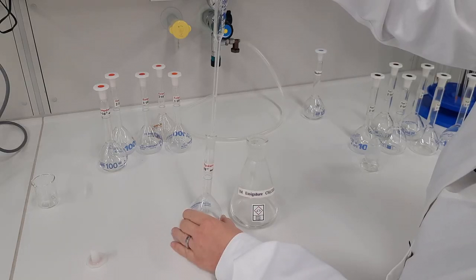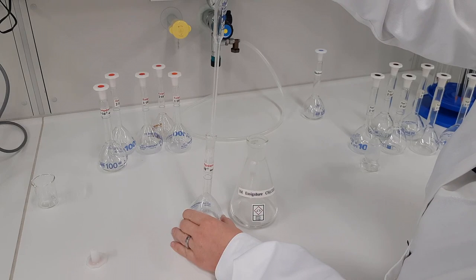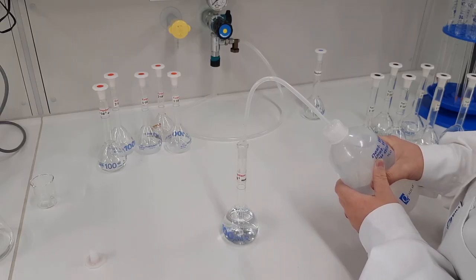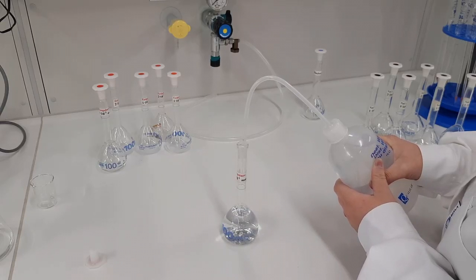First of all, dilution series of both electrolytes have to be prepared using one molar stock solutions. Care should be taken to always use a clean and dry pipette for each solution preparation.